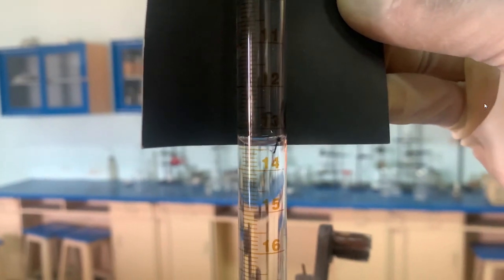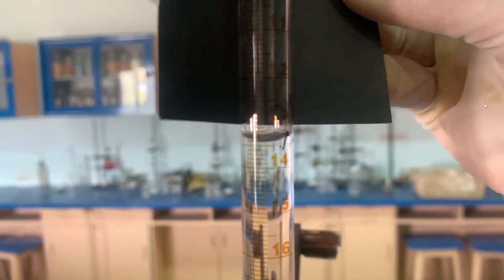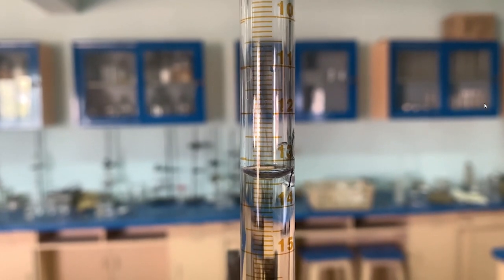We will read the lower meniscus. After recording the final volume, we will subtract the initial volume from the recorded final volume to get the answer — the volume of acid used. This is the way through which we record the volume.